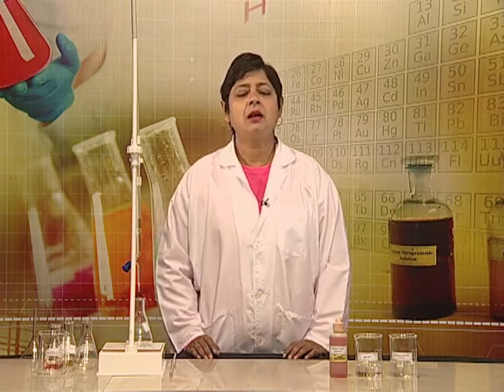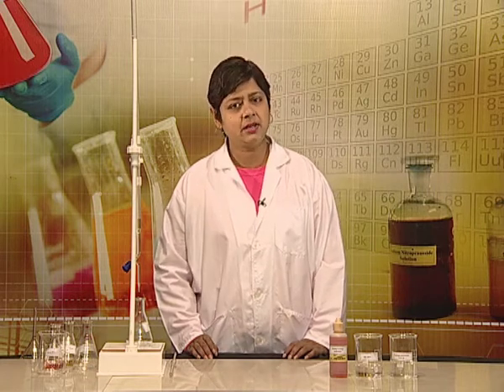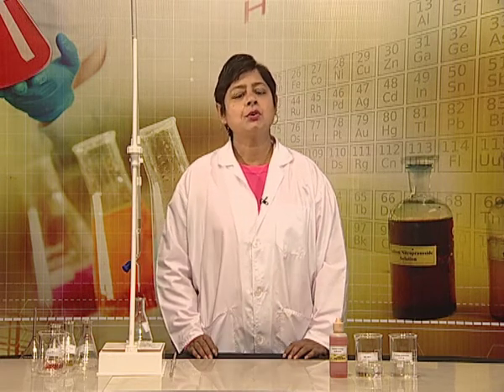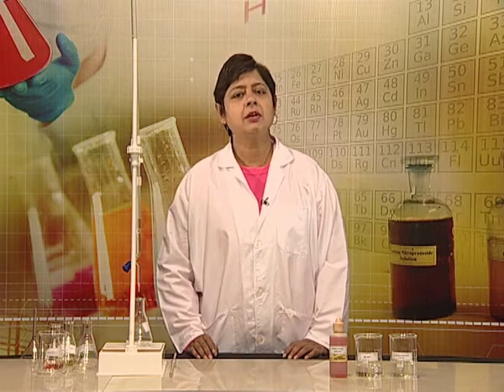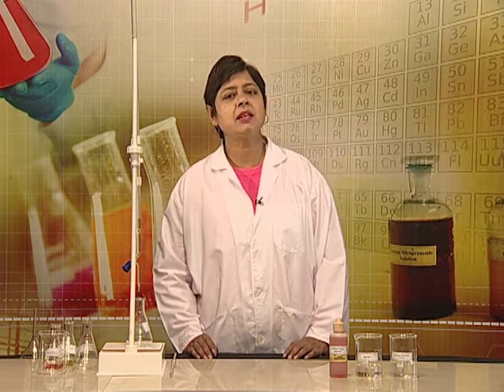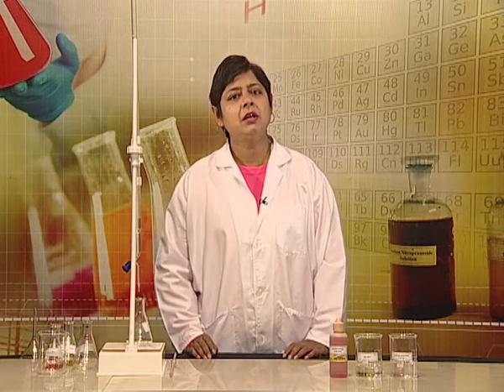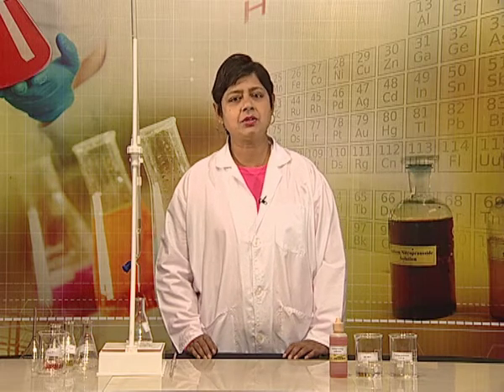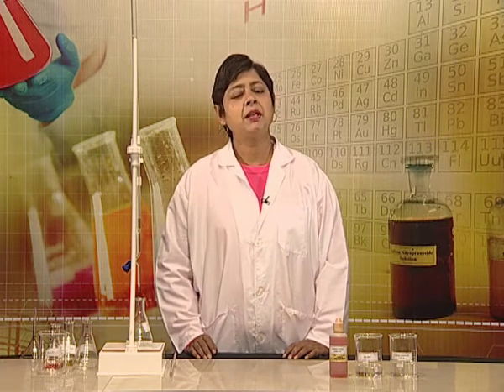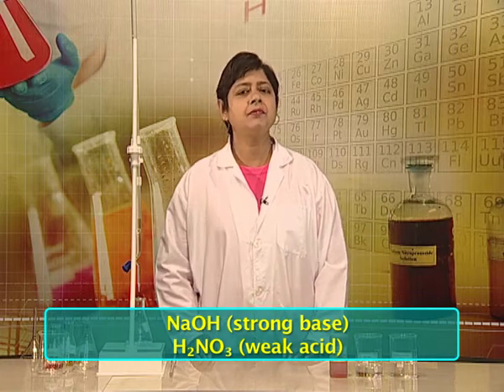Today, we are going to determine the strength of a given solution of hydrochloric acid by titrating it against a standard solution of sodium carbonate. Sodium carbonate and hydrochloric acid react to give sodium chloride, carbon dioxide, and water. As the reaction is between an acid and solution of a basic salt, the reaction is called a neutralization reaction and the type of titration is called acid-base or neutralization titration. Please recall that sodium carbonate is an example of a salt of a strong base and a weak acid.